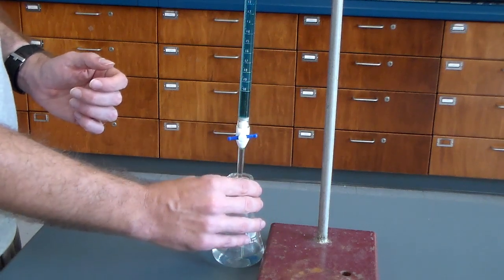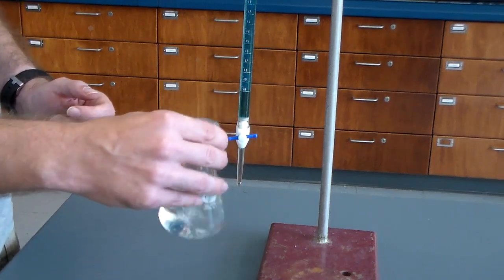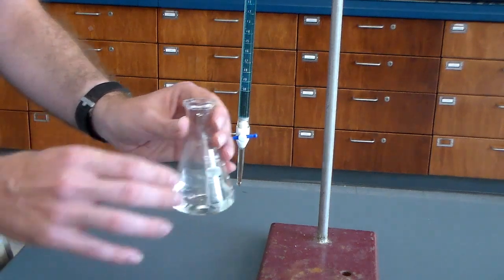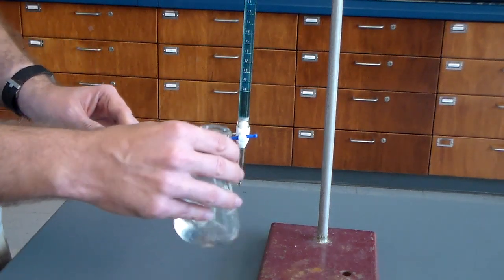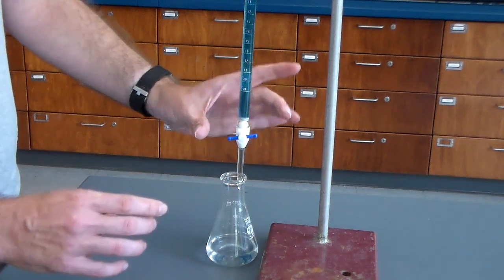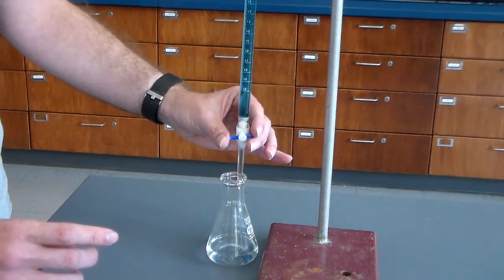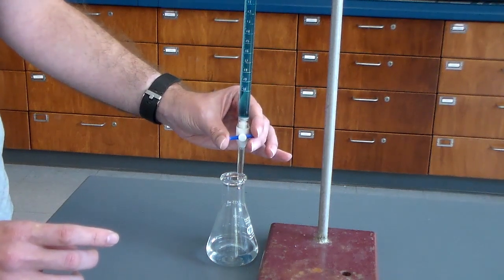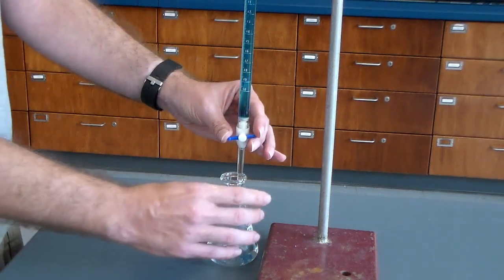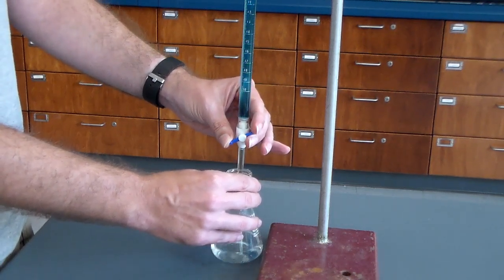So in your right hand, you want to be holding your flask because it's going to be very easy to swirl the flask with your right hand, but you try swirling it with your left hand, you're probably not going to have as quite an easy time. So make sure you're swirling with your right hand, unless of course you are left-handed. And then what we want to do is, notice here is my left hand, and for my left hand I'm going to be reaching around so I can control the knob over here. So what you're going to do is swirl with your right hand while controlling the flow rate here with your left hand.